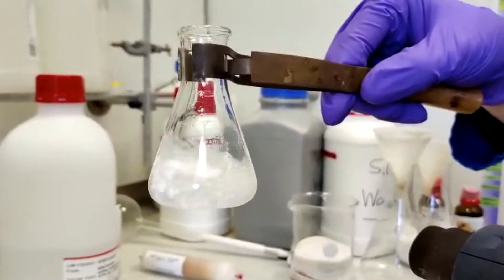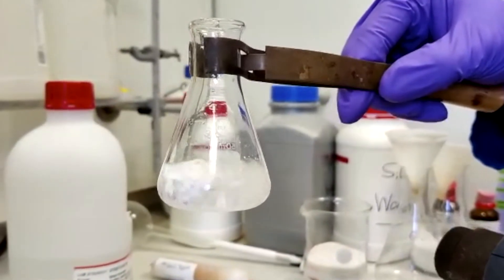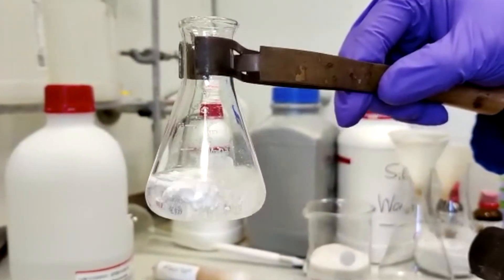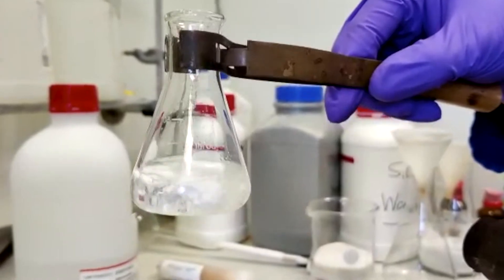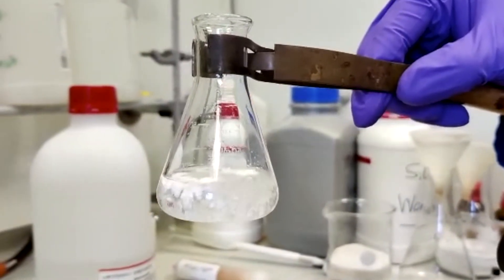As you can see this is now boiling vigorously so we can be confident that any impurities present will dissolve and so we can leave it to cool down and then we'll put it into an ice bath, filter it and we'll have our product.